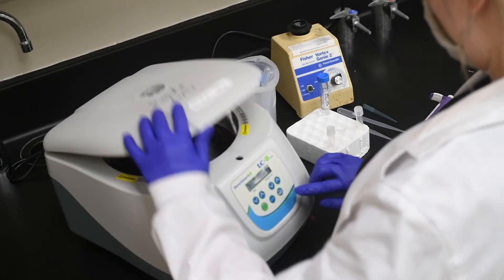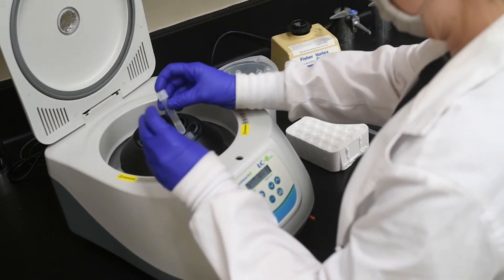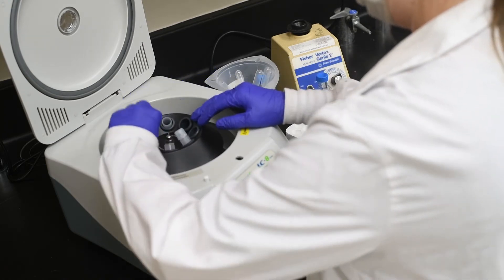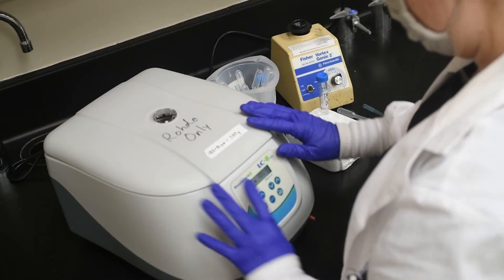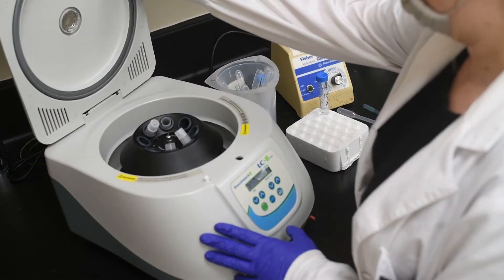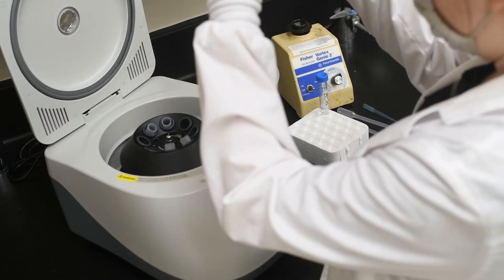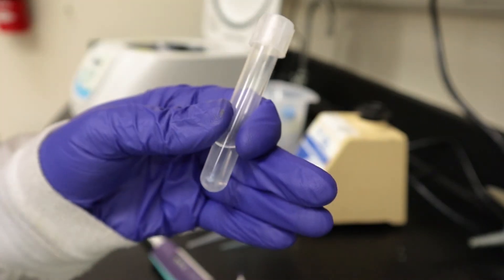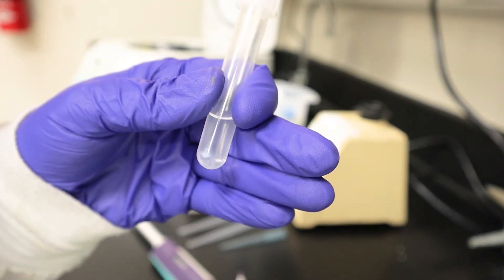After 3 hours passed, I placed my cells in the centrifuge for 5 minutes. After centrifugation, I carefully removed the supernatant without disturbing the pellet. The pellet should resemble more of a smear at this point in the protocol.